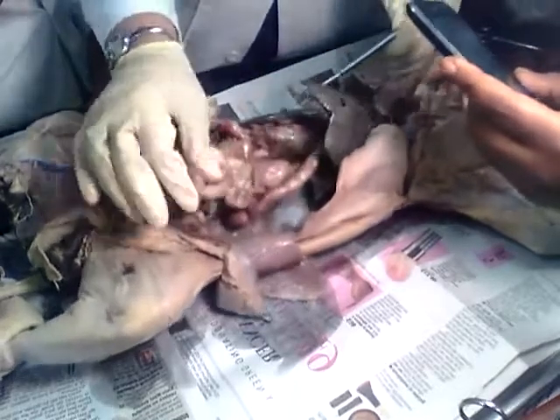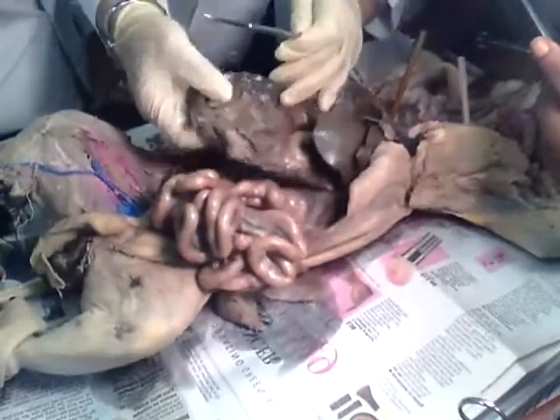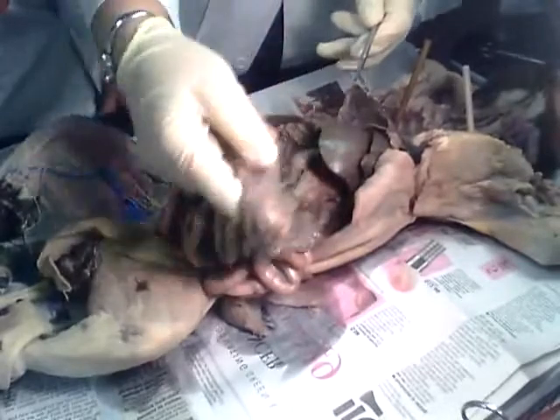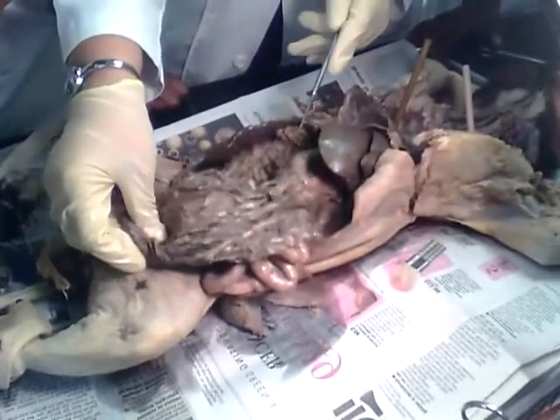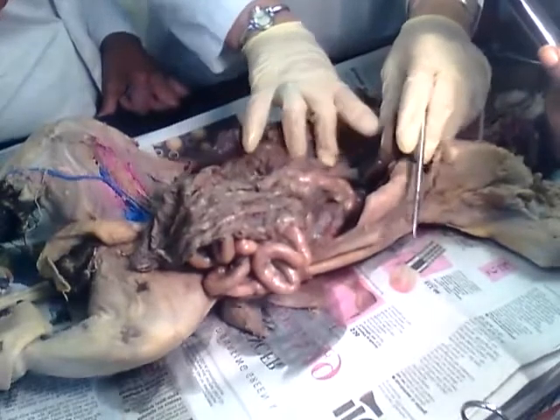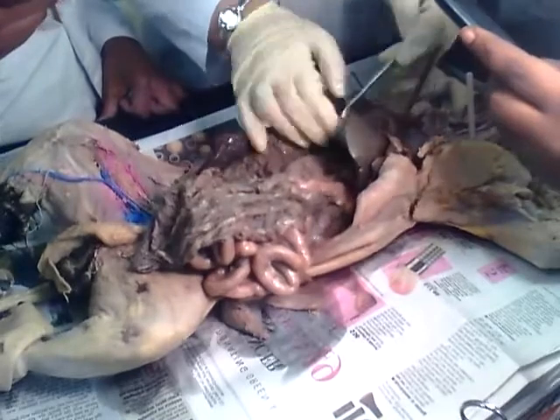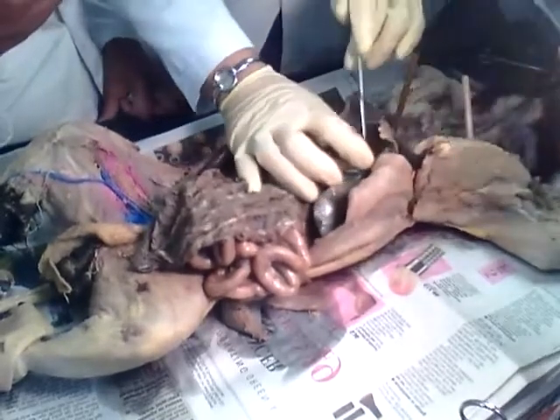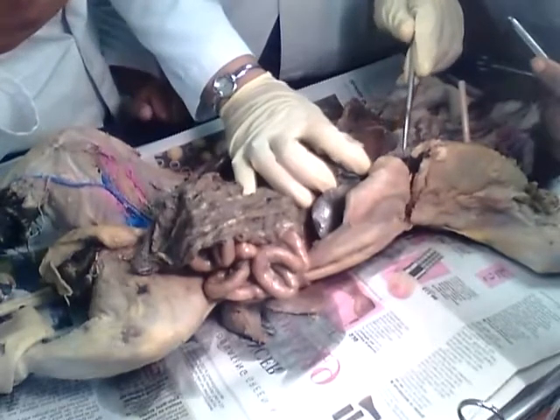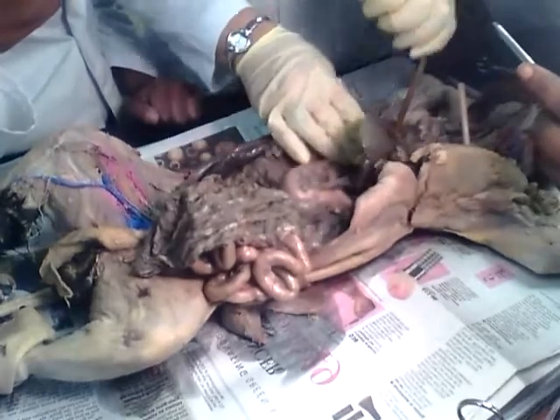Now, we also have this fatty tissue. What is this? Greater omentum. You see how it covers the intestine like an apron, right? I'm going to ask you all that, people. Pay attention. And then this must be the lesser omentum. Very good. Now here we're going to encounter a ligament. What's the name of this ligament? Falciform ligament, that is going to divide the liver. Very good. Excellent.